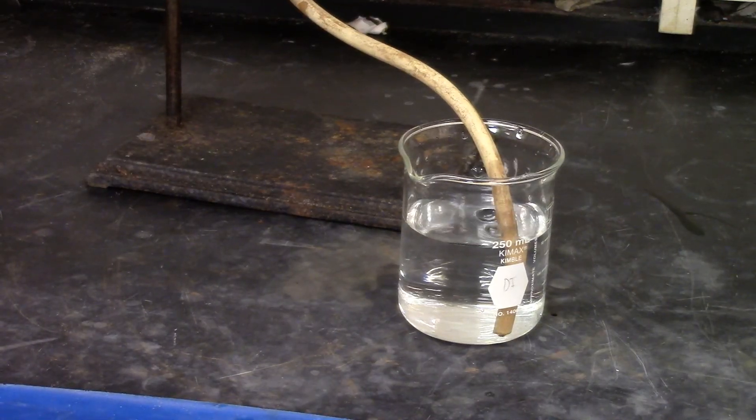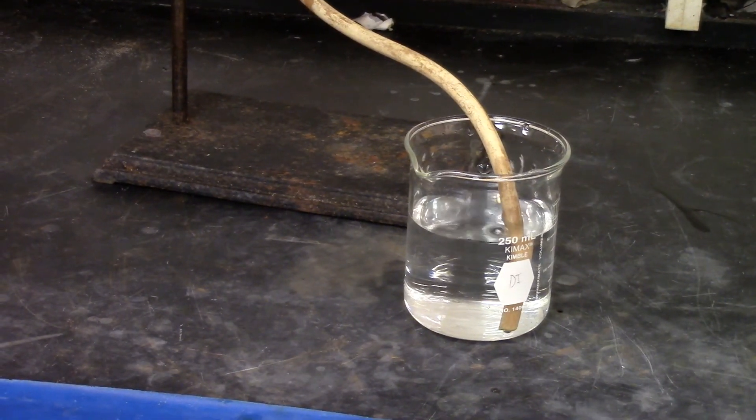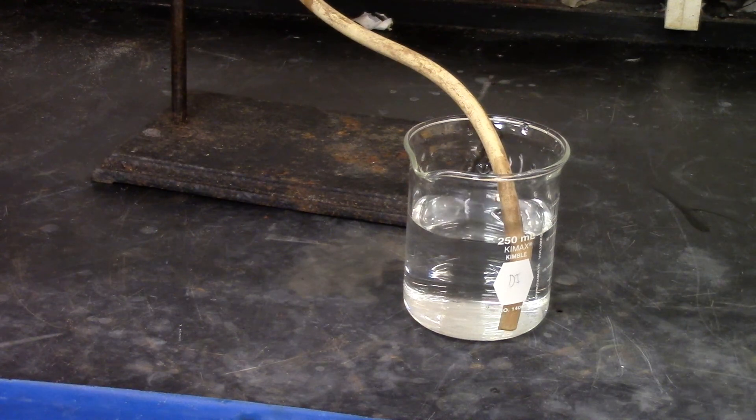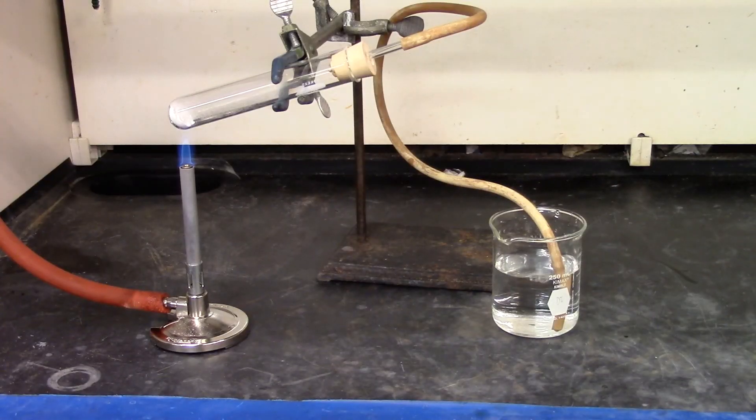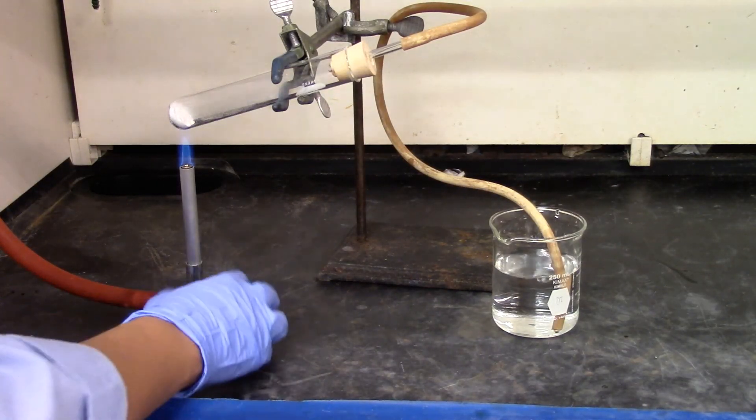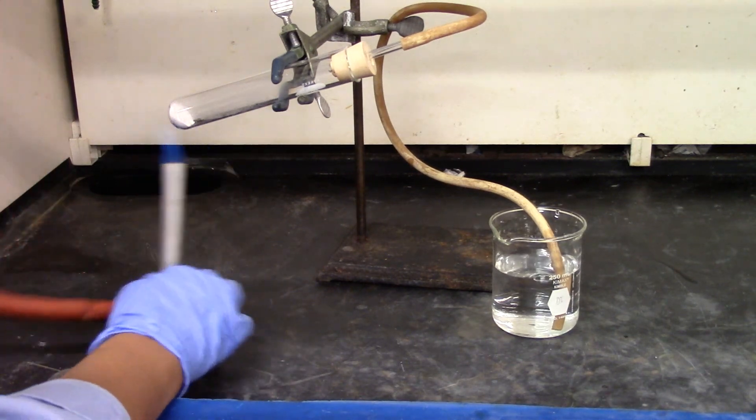You do see bubbles coming in the water. The decomposition of baking soda is going on. We'll keep heating the baking soda and stop heating it when the bubbles slow down.